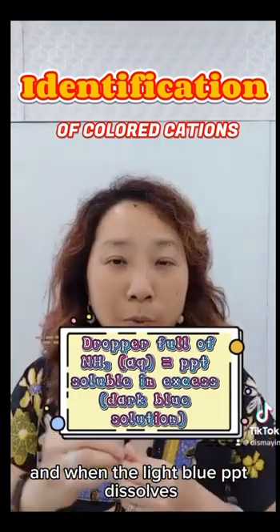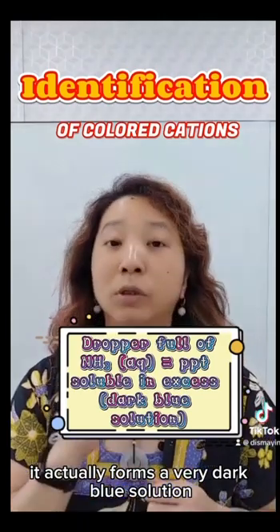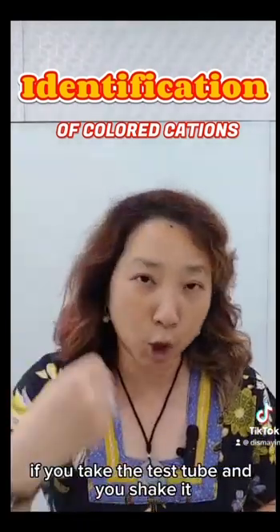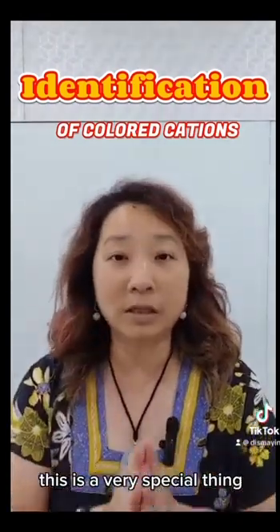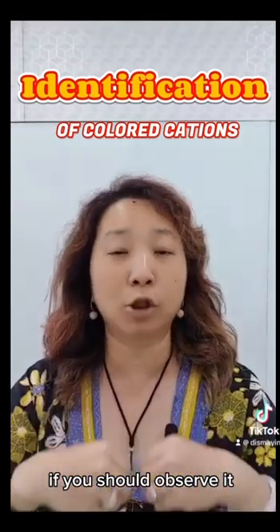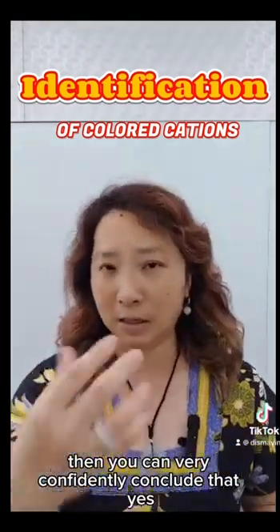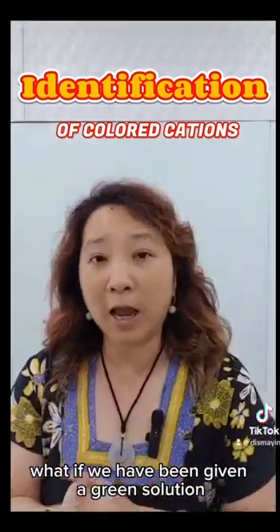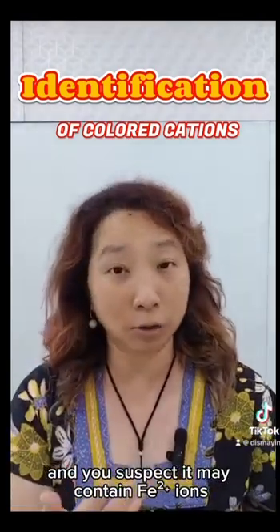And when the light blue PPT dissolves, it actually forms a very dark blue solution. It's very outstanding. It's very obvious. In fact, if you take the test tube and you shake it, the entire test tube will now turn out dark blue. This is a very special thing. If you should observe it, then you can very confidently conclude that yes, this unknown solution contains copper 2 plus ions. What if we have been given a green solution and you suspect it may contain iron 2 ions?